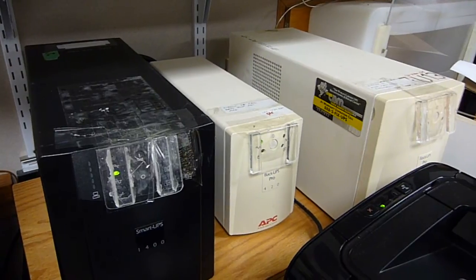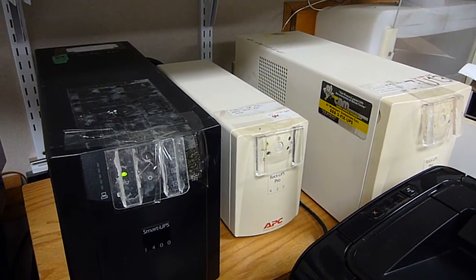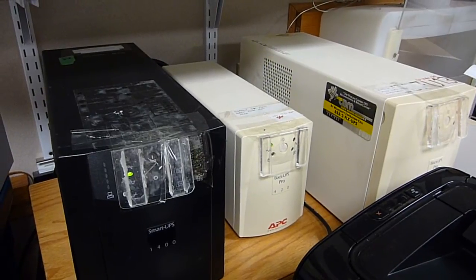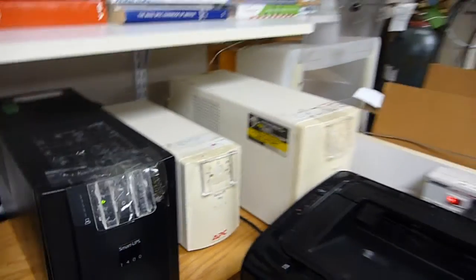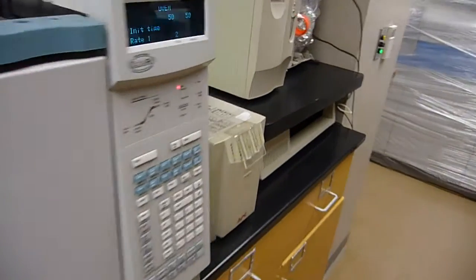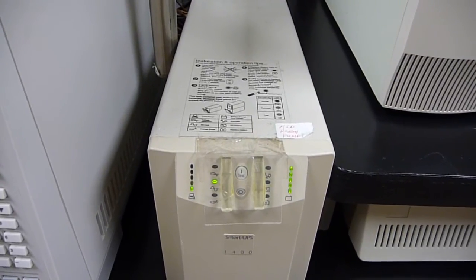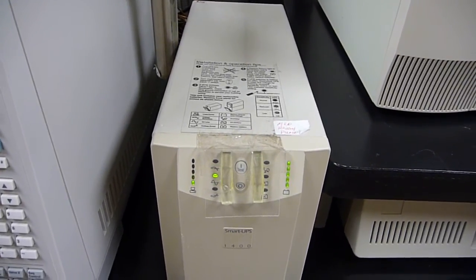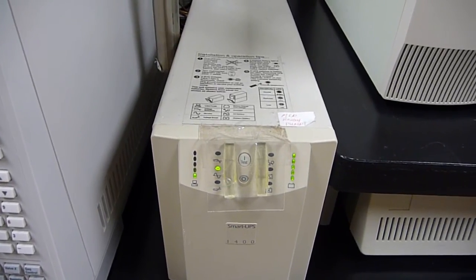The trick is that for our diffusion pump based system, we have UPSs. In fact, these are three UPSs out of the four. The fourth one is over here for the rough pump. Let me explain the system and why I think it's a modification that you might want to consider.